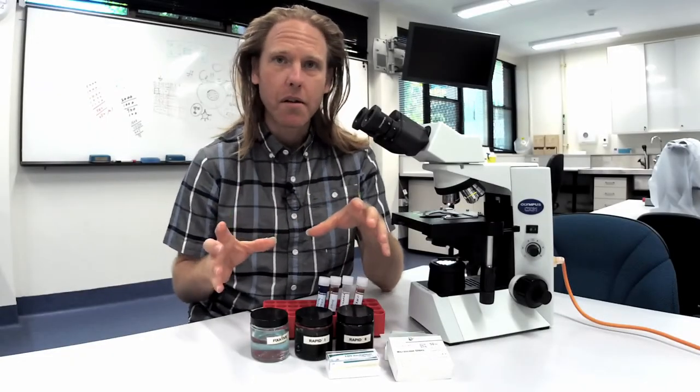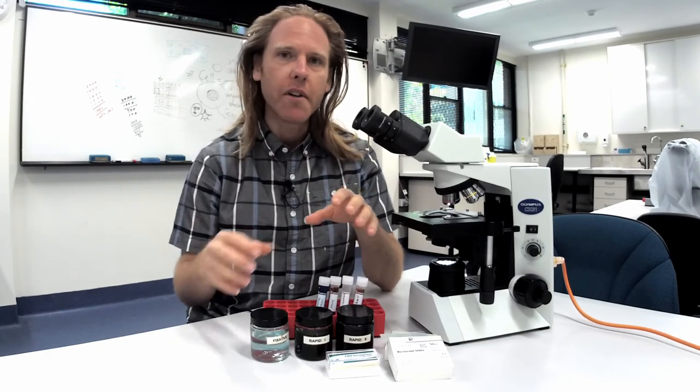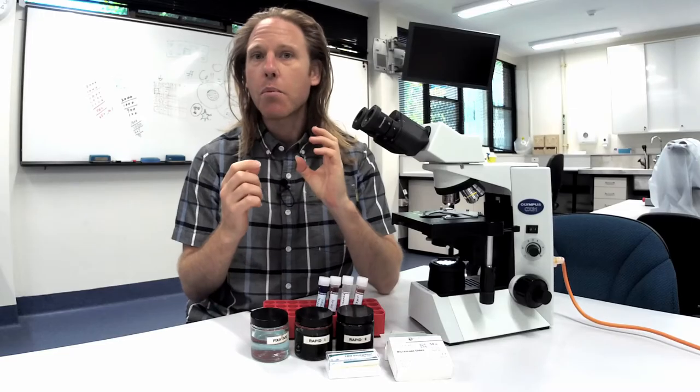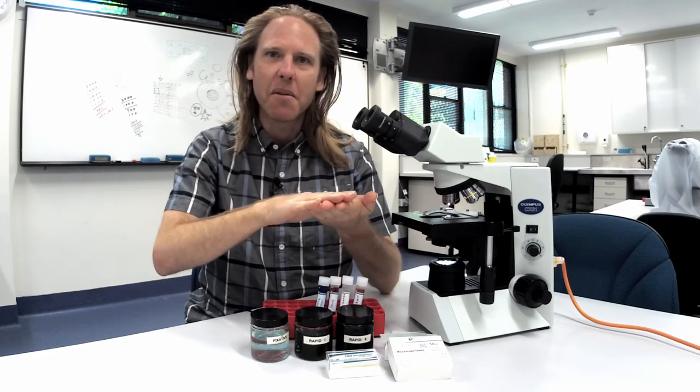Label slides in pencil. Labeling in pen is easy but the ink will dissolve in the solvents used in the various stains. Write the patient's name and the site sampled on the frosted part of the slide and then when you collect the sample make sure that the sample goes on the same side of the frosted part.